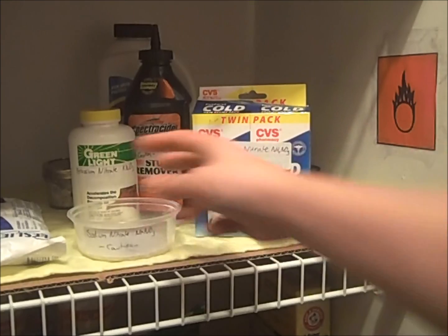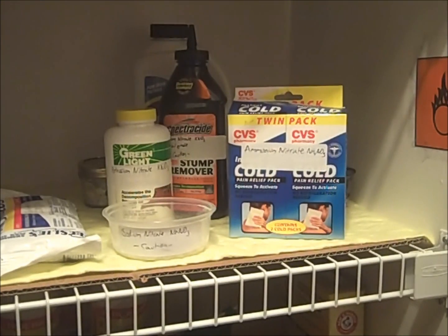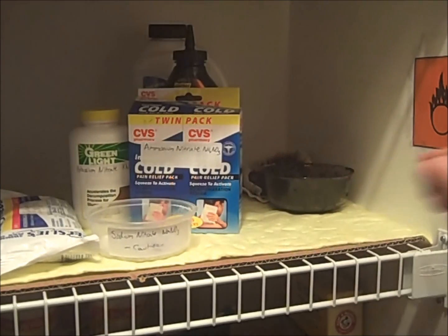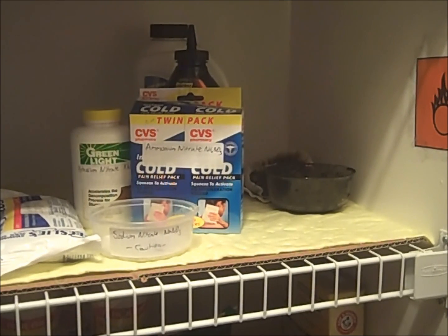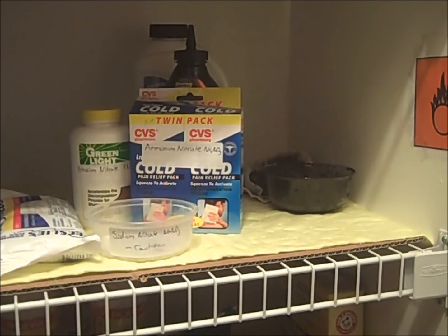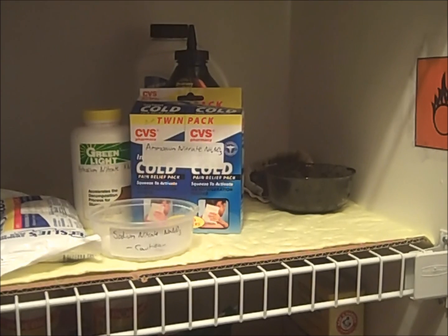This is sodium nitrate. It is produced by mixing sodium hydroxide and ammonium nitrate in stoichiometric amounts, and then evaporating off the water. Again, it's slightly impure as is, so a recrystallization is recommended. This is manganese dioxide obtained from batteries. Six-volt batteries contain four cells, each of which contain large amounts of manganese dioxide, in addition to some zinc and carbon.